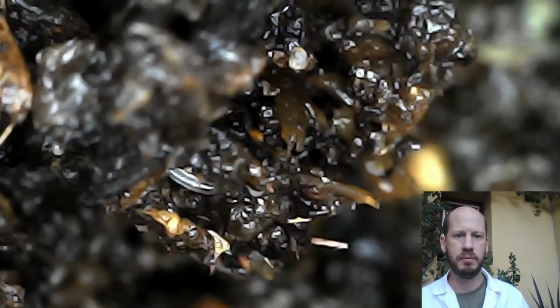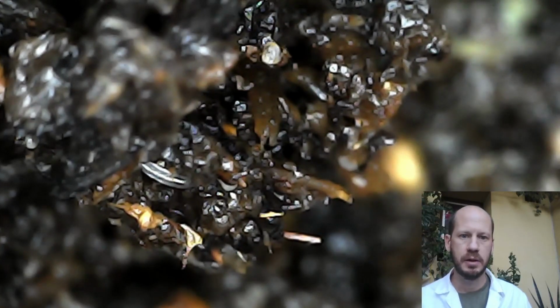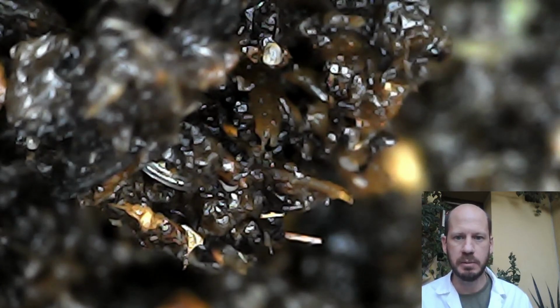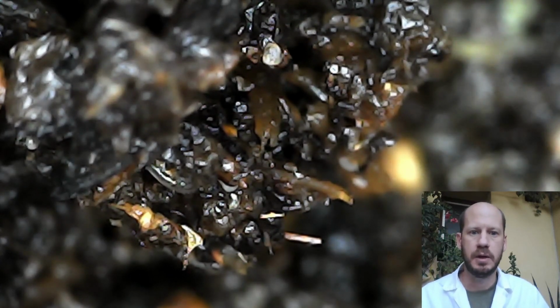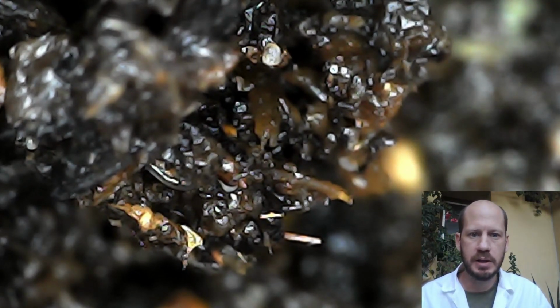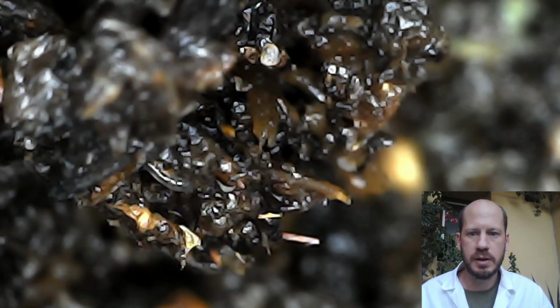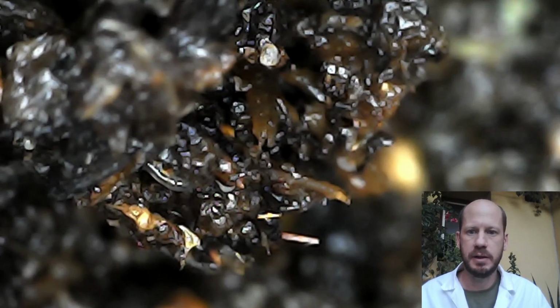And you can see microbes, instead of moving them outside their habitat, you can see them behaving naturally in their habitat. You can see them feeding. You can see them, even mating. Some worms mating, and many other behaviors you can see in nature just by having something like this to explore your curiosity.